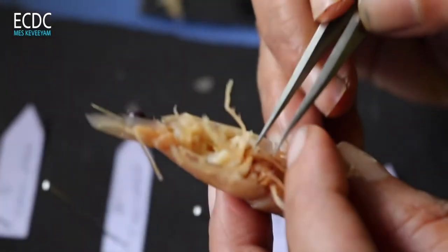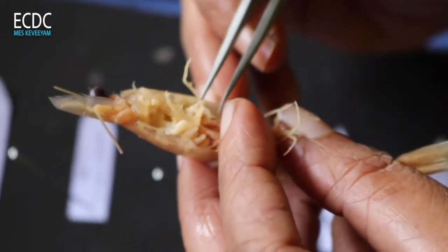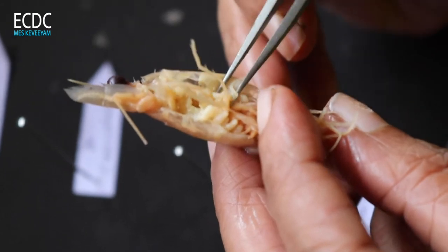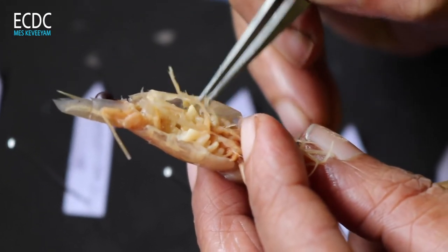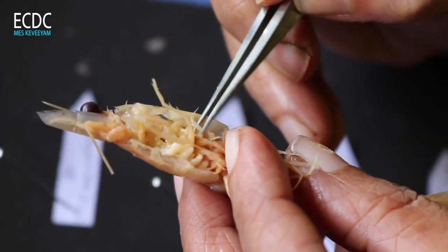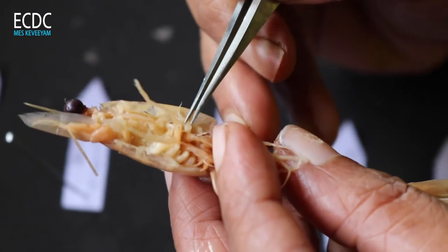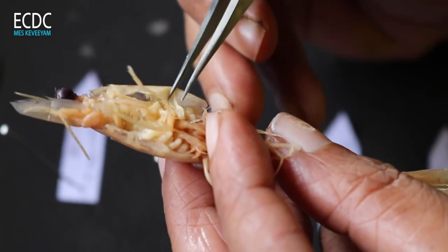Now we have chelate legs. This is the first chelate leg. The epipodite will be cut. Here is the epipodite.